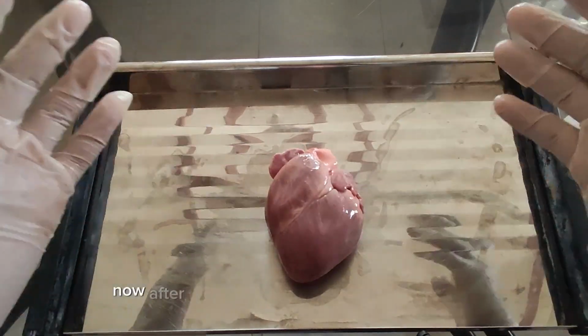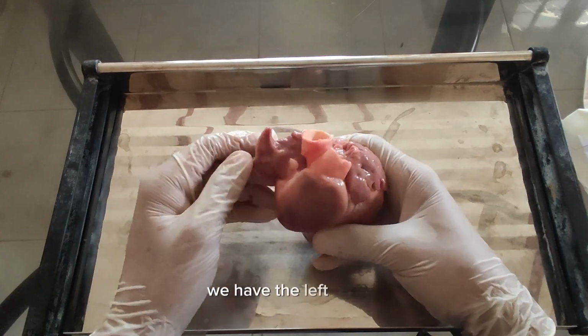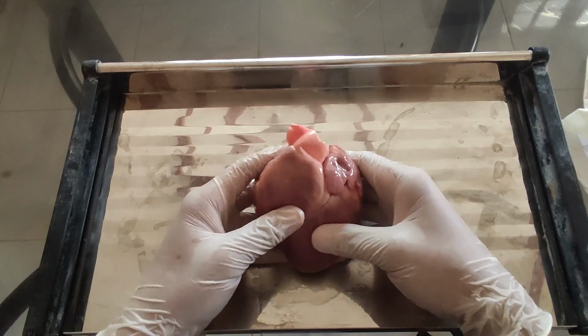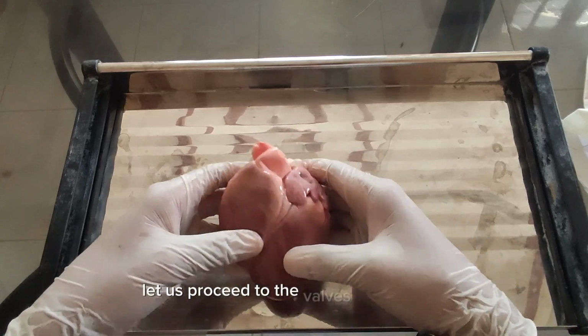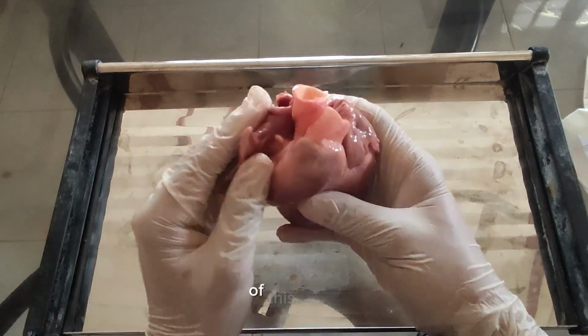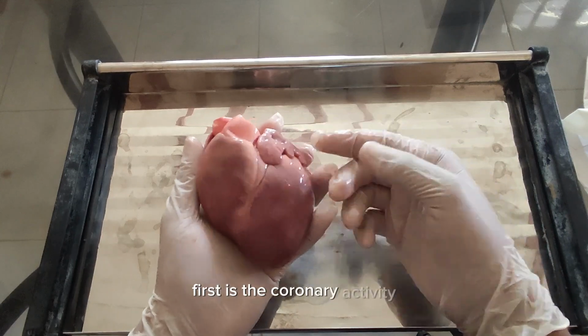Now after pinpointing the chambers of the heart, we have the left atrium, the right atrium, the right ventricle, and the left ventricle. Let us proceed to the valves, arteries and vessels of this heart. First is the coronary artery.